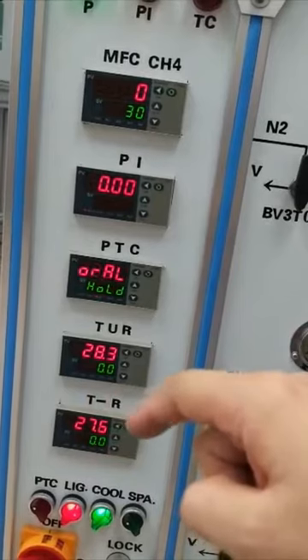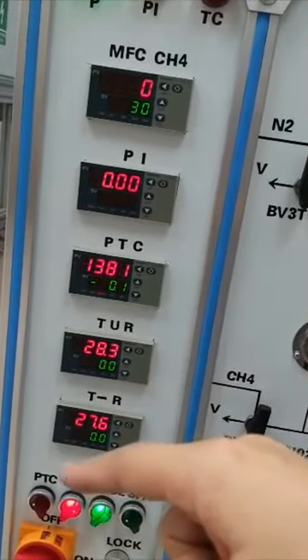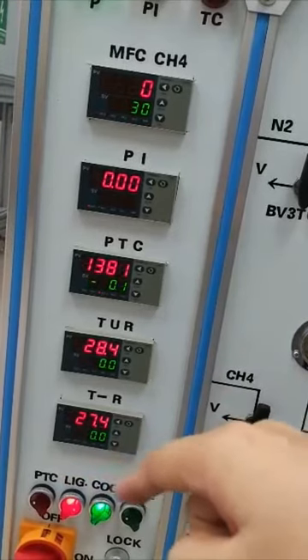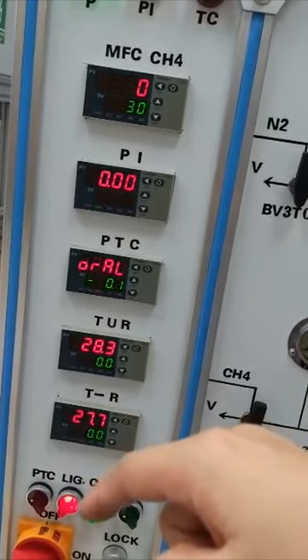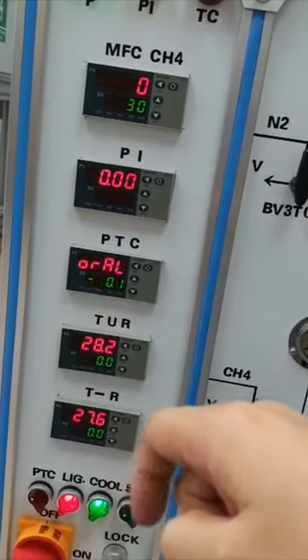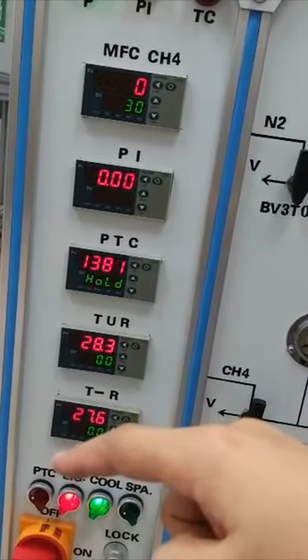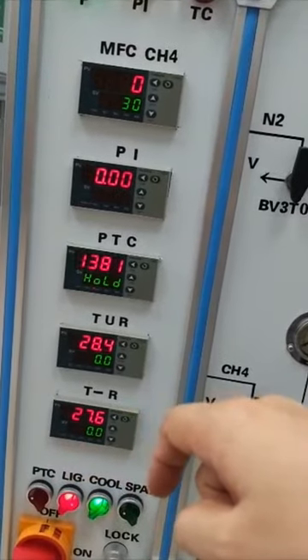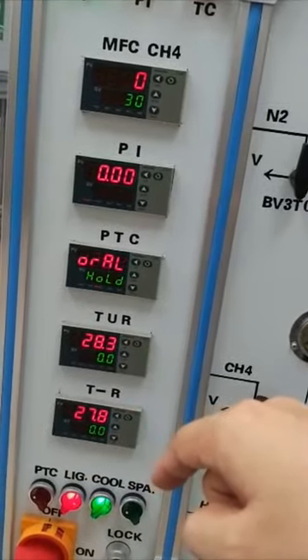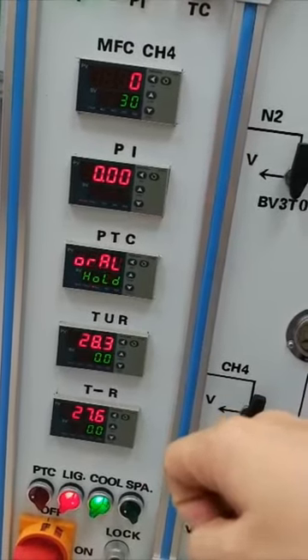This one is now connected to the cooling system, and there are switches installed, the switch of the light and the switch of the cooler. This is a spare part for a program temperature controller, and there's an extra spare switch.